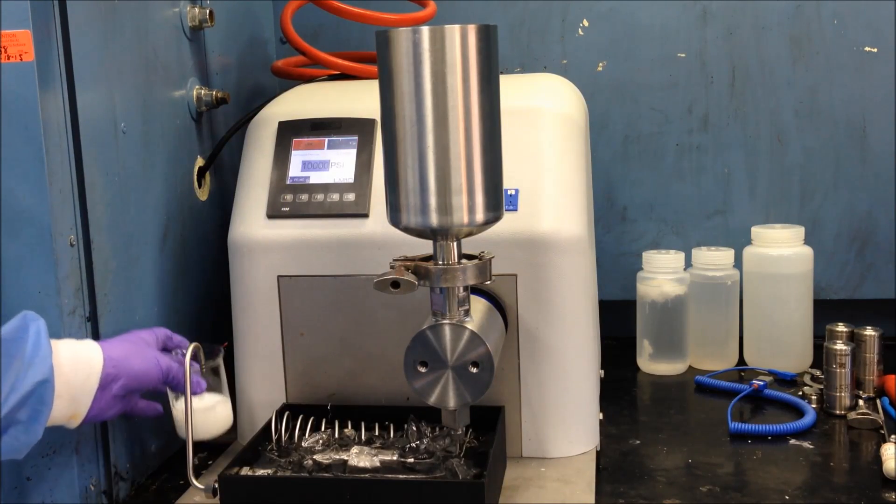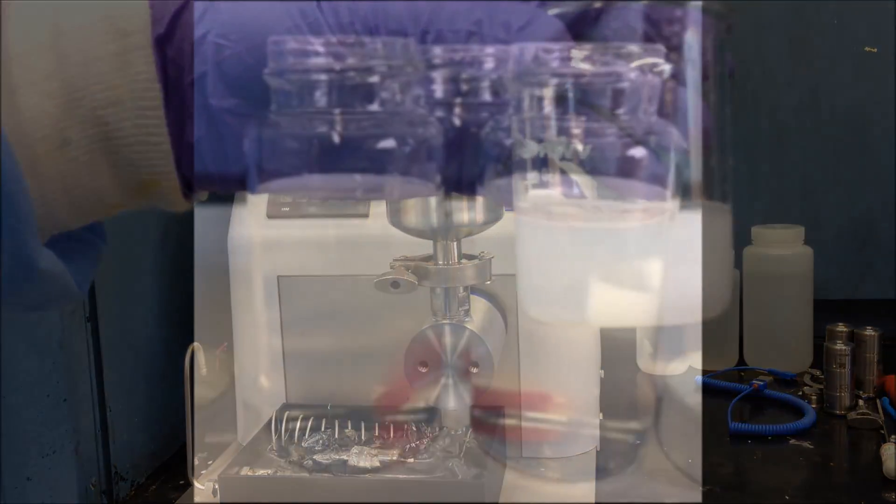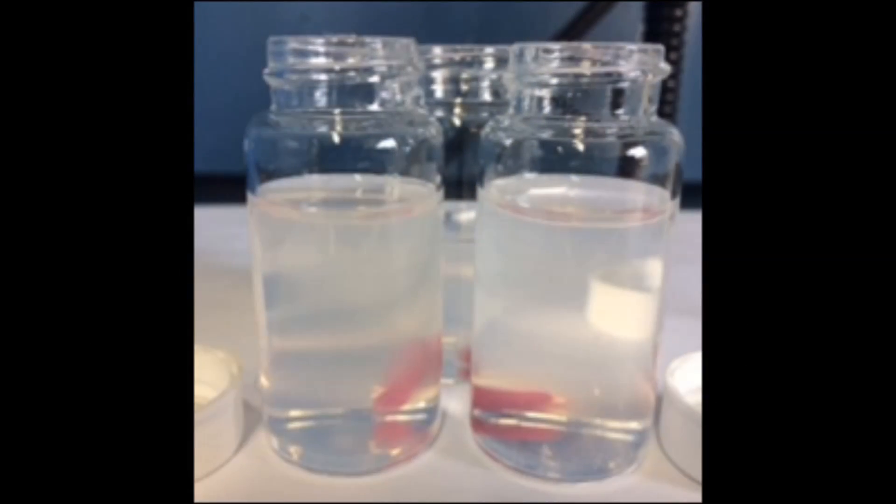For this study, samples were collected at 1, 2, and 5 passes. After collection, the samples were allowed to sit on a stir plate uncovered to allow the solvent to evaporate. This is just one of many different solvent extraction techniques.